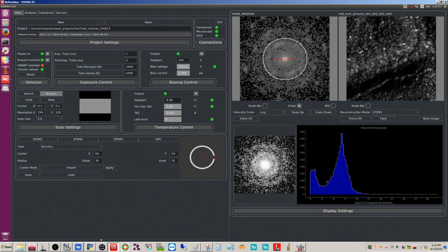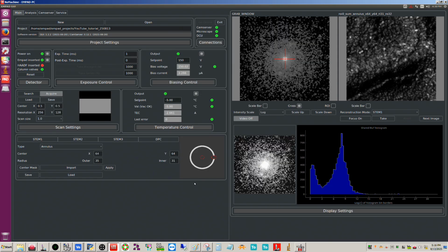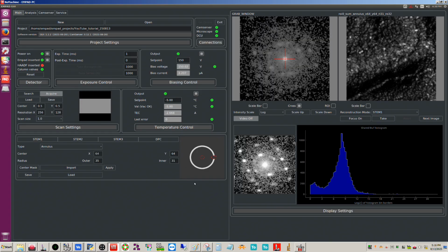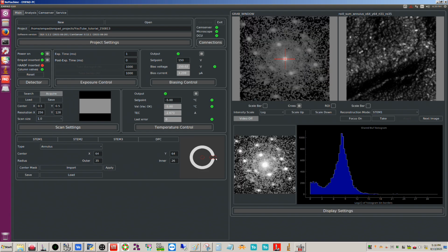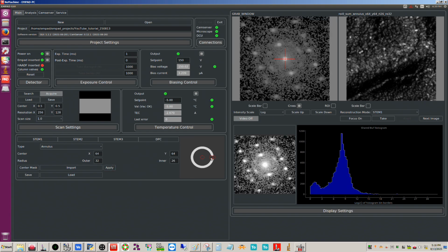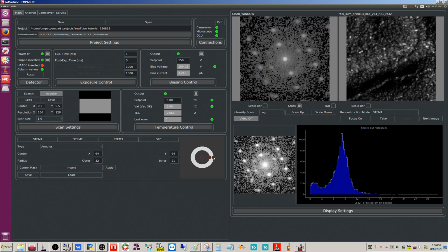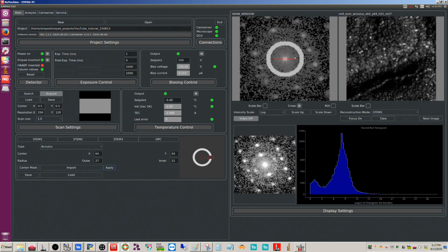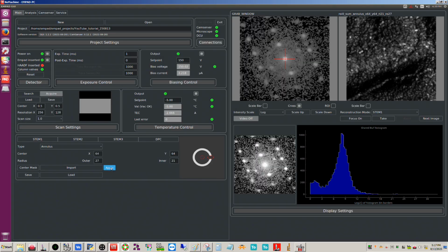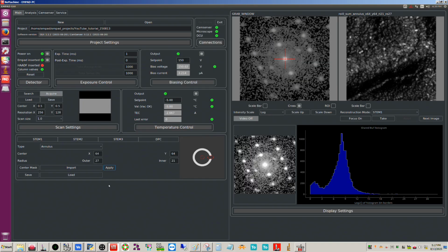So why don't we, just for fun here, unblank the beam and do video on. We move the sample here so we can see a little bit more. Okay, so if we do apply, I'm going to move. Go down even more. Okay, and then I'm going to bring that down. Go 27. Basically I'm isolating this radius right here, as you can see. And I think that's going to be the 111 reflection, if I'm not mistaken. So we'll go ahead and use that for our reconstructed image.